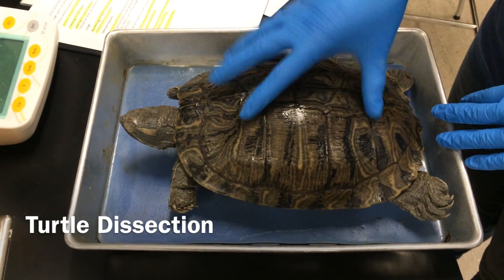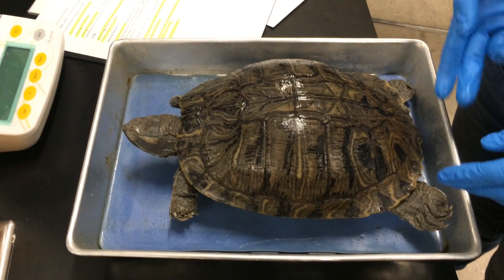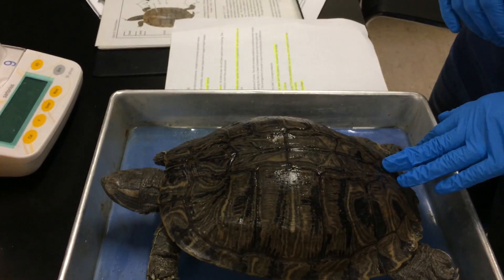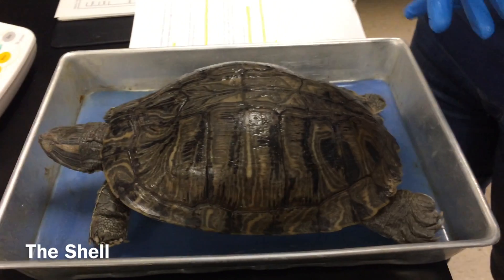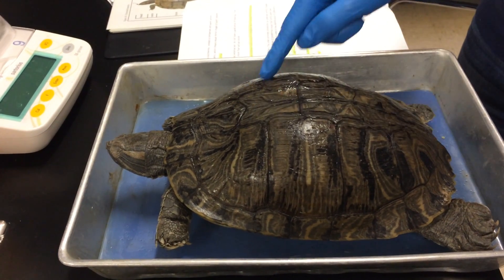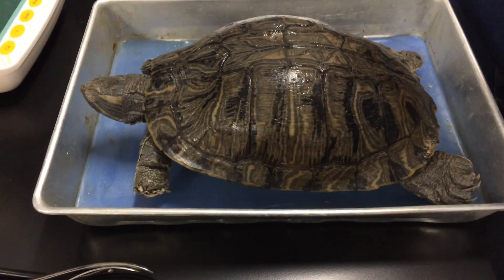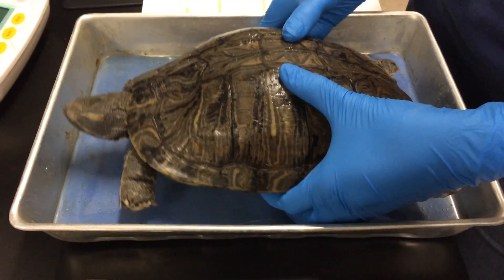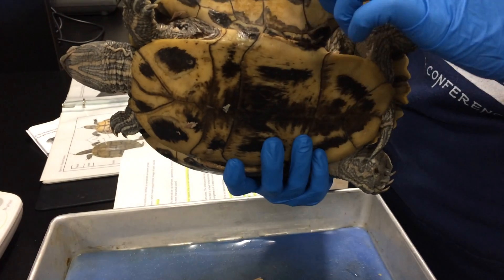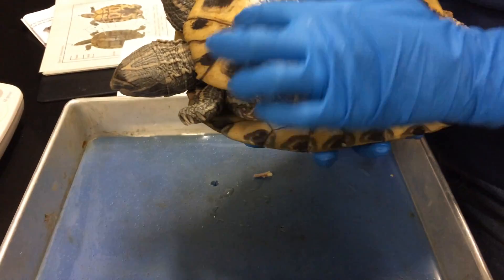Here's the turtle. This is the top, which is the dorsal side. This is the anterior where the head is, and then this is the posterior. Underneath is the ventral. The shell on top is called the carapace, and this is a layer of epidermal tissue that forms plate-like structures called scutes — these structures right here. The arrangement of scutes is used to identify different turtle species. The bottom is the plastron, and in between these two is called the bridge. There are also scutes on the bottom here as well.